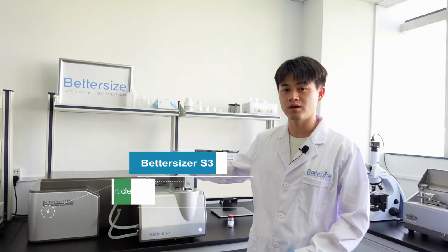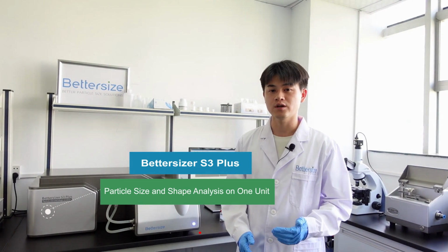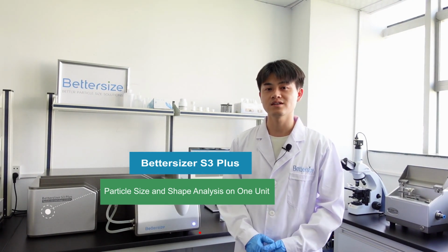Today, I'm going to introduce the latest generation of particle size and shape analyzer, Bettersizer S3 Plus, which combines laser diffraction and dynamic image analysis. It offers unique and comprehensive particle size and shape characterization possibilities from the nanometer to millimeter range.